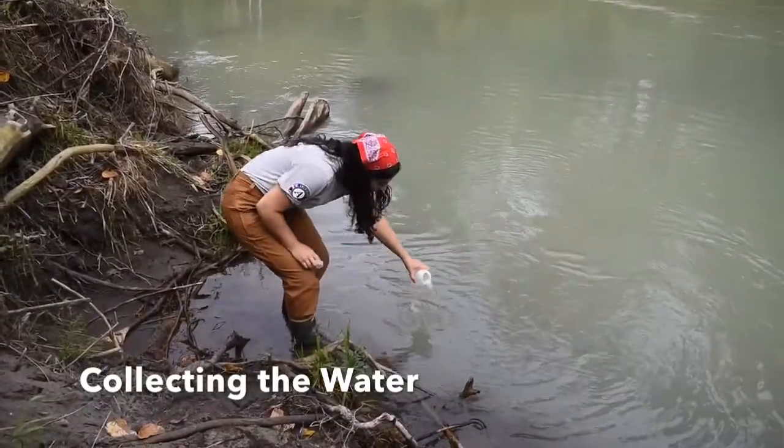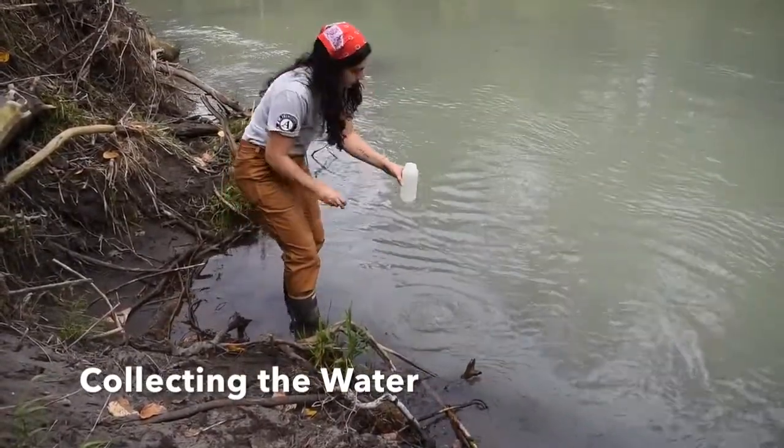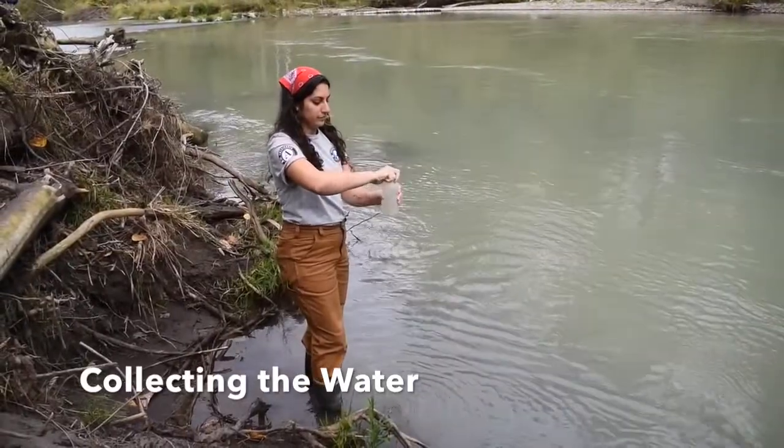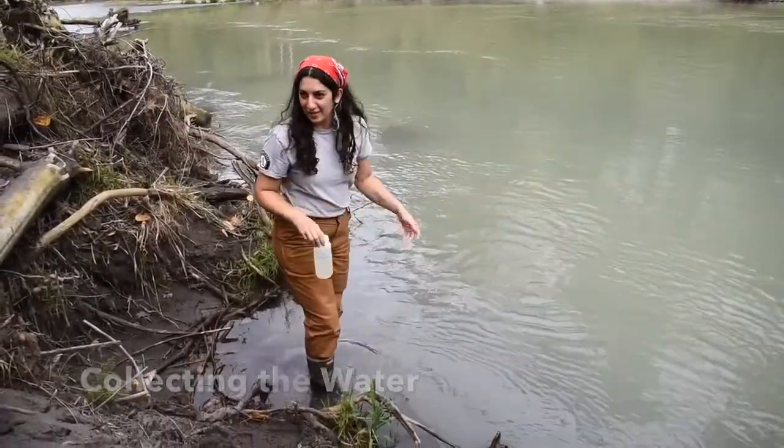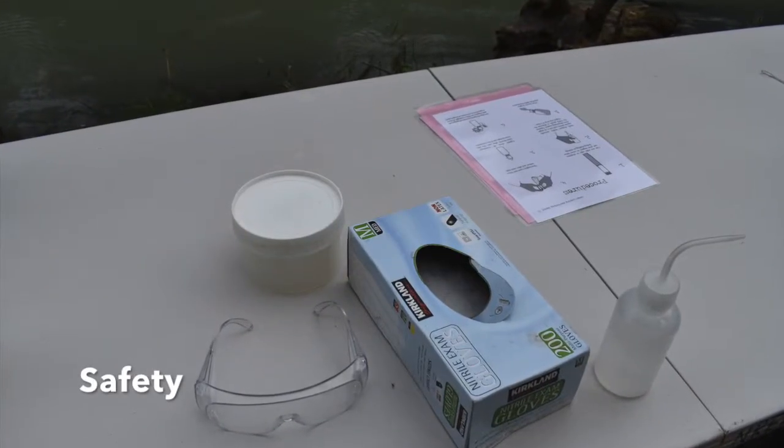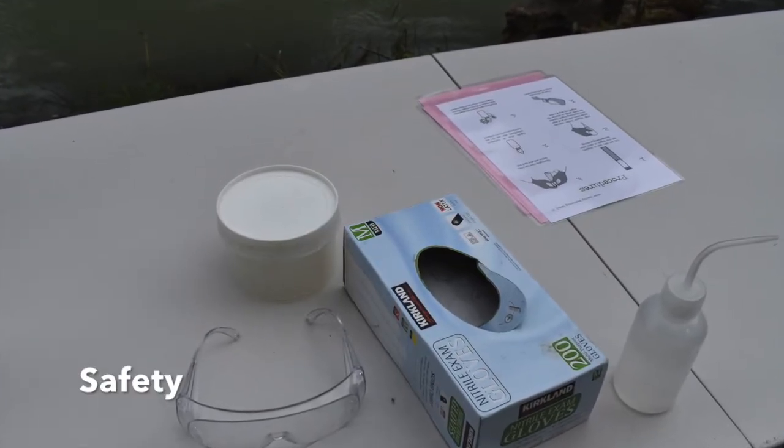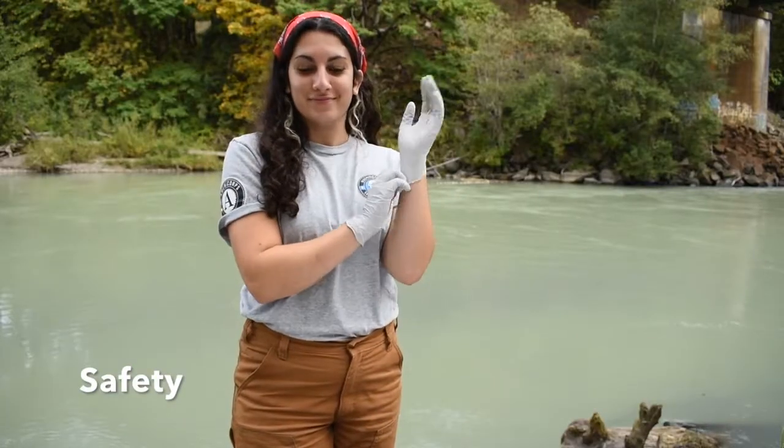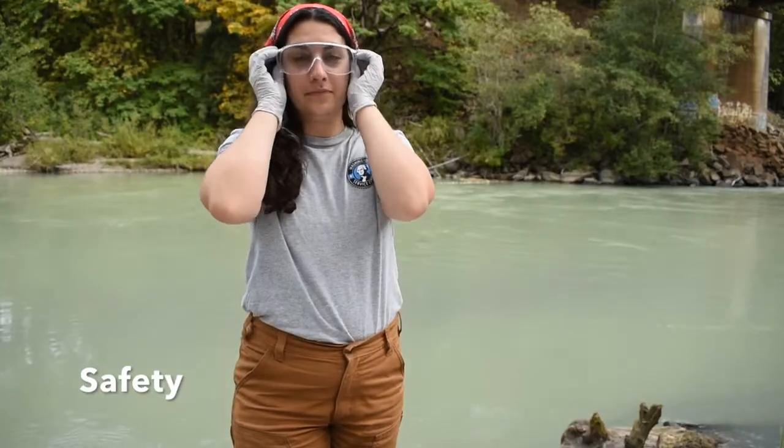The next thing we need to do is gather a bottle of river water for our sample. Let's talk safety. We're going to be doing these tests with chemicals, so it's important that we wear gloves and goggles at all times.